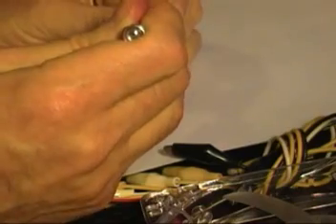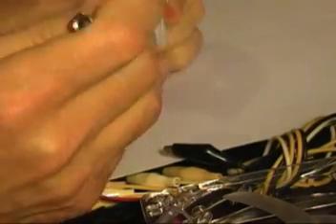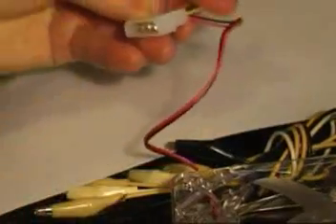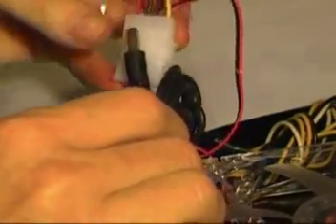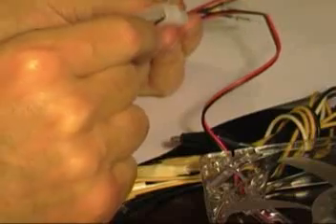Depending on which one you're pulling, it probably doesn't make much difference because we're going to re-solder these anyway. Here it is finished — I've got the one plastic connector off, and I'm showing you how we're going to use it to connect the power supply. I'm going to cut that plug off and then solder some connections here.